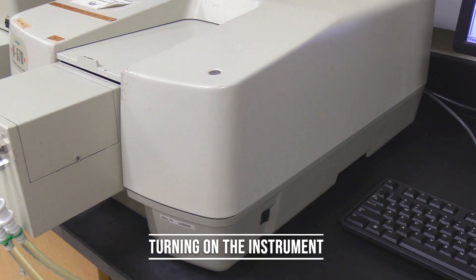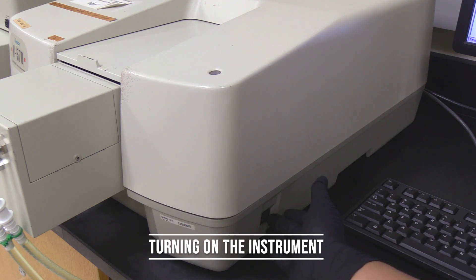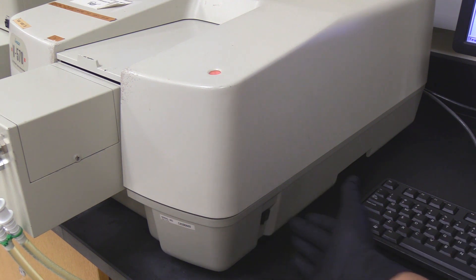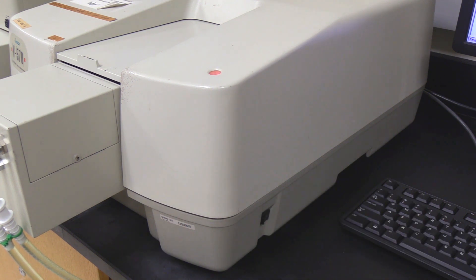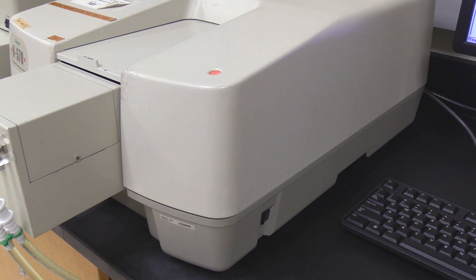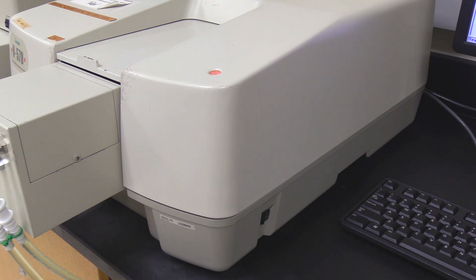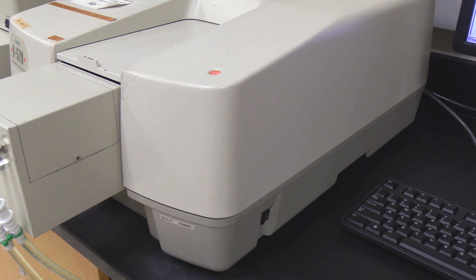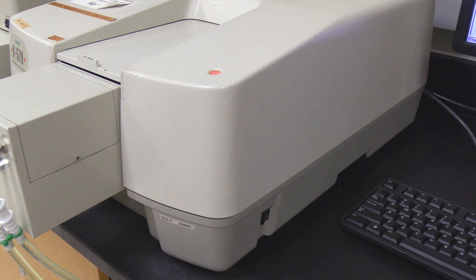Turning on the instrument. Flip the power switch on the right side of the instrument. The red indicator light should turn on. For the best performance, allow the instrument to warm up for at least 30 minutes. One hour is preferred.